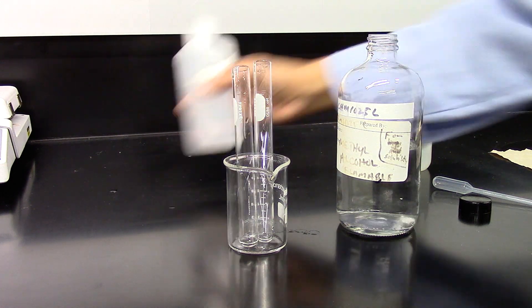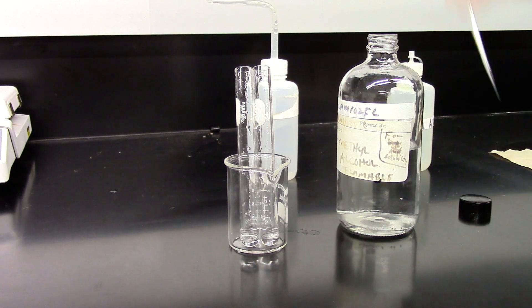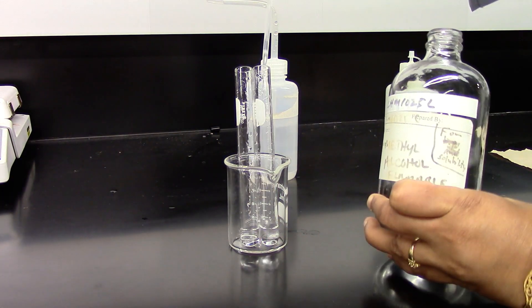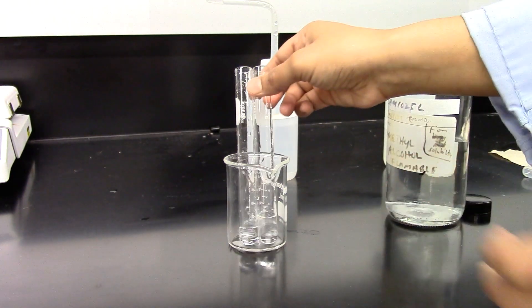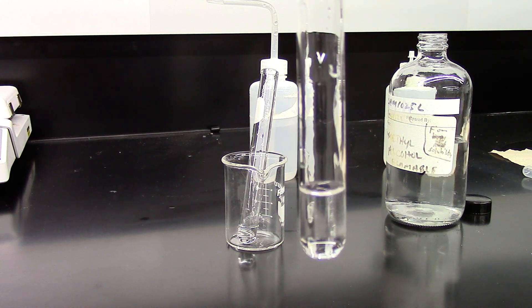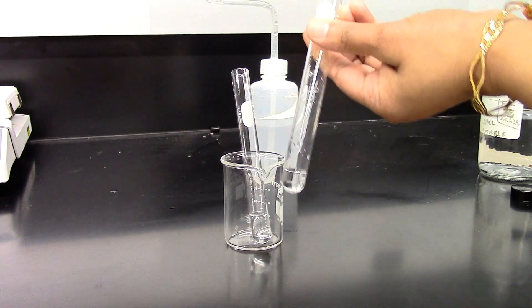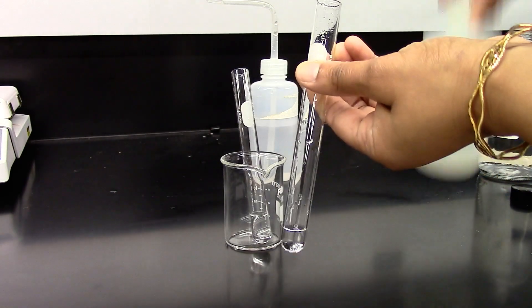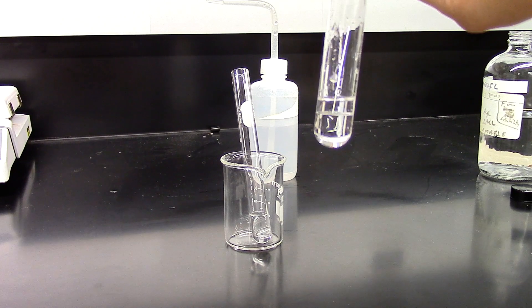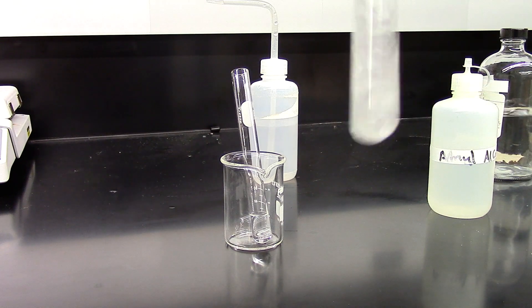I have two test tubes and I am going to add 20 drops of water in each. In one test tube I am adding some methanol — it is clearly miscible. To the other test tube I am going to add a few drops of amyl alcohol and give it a mix.